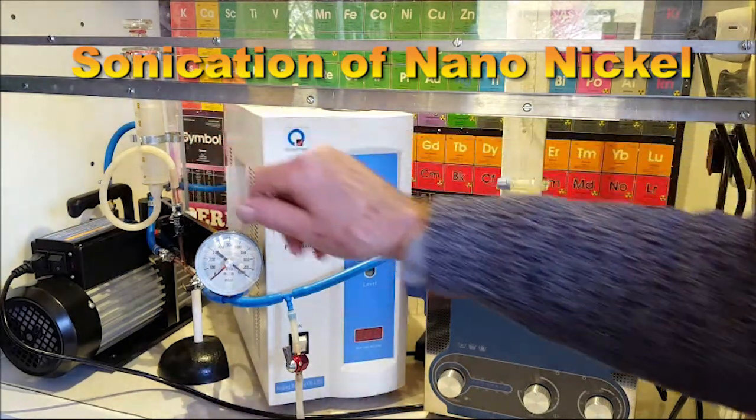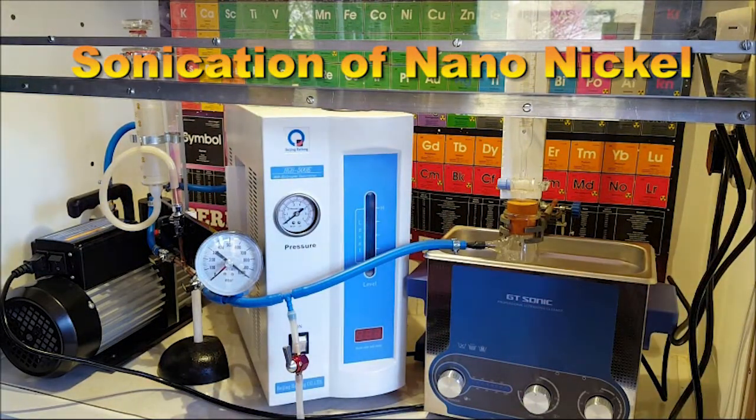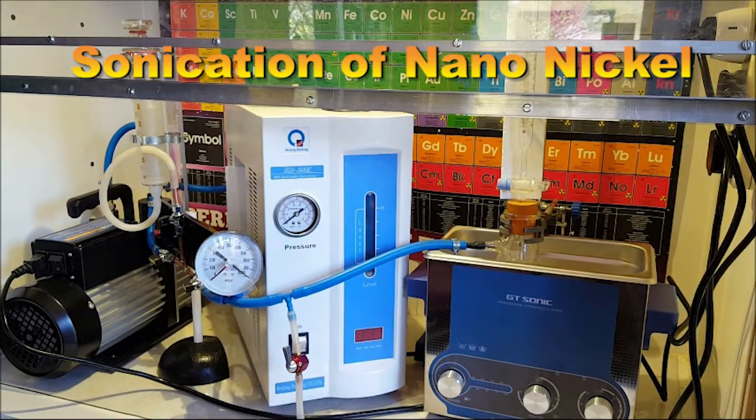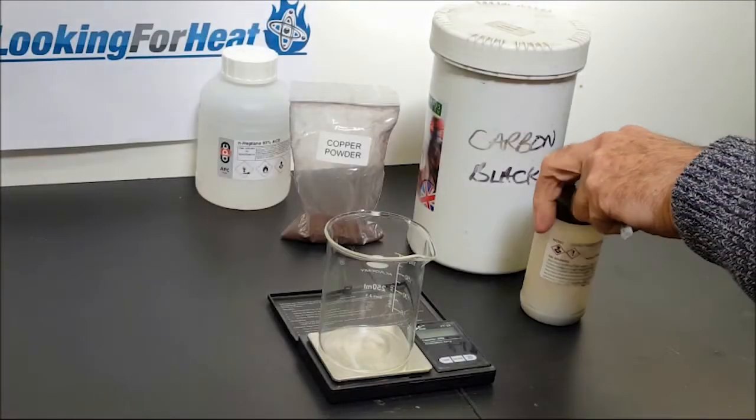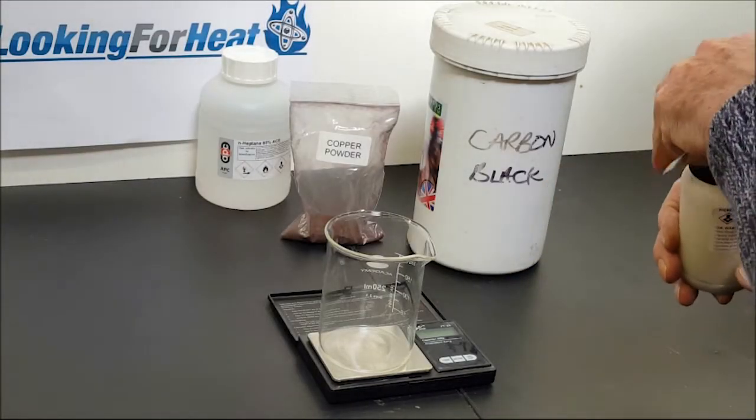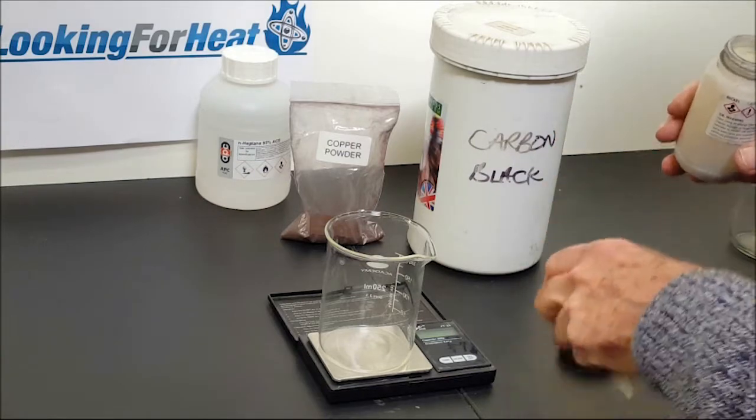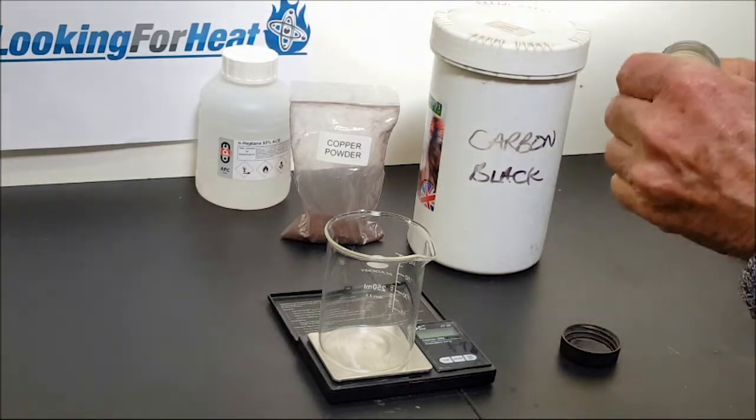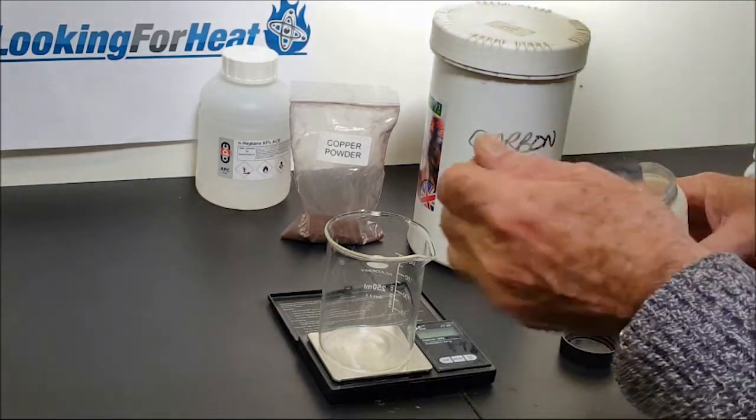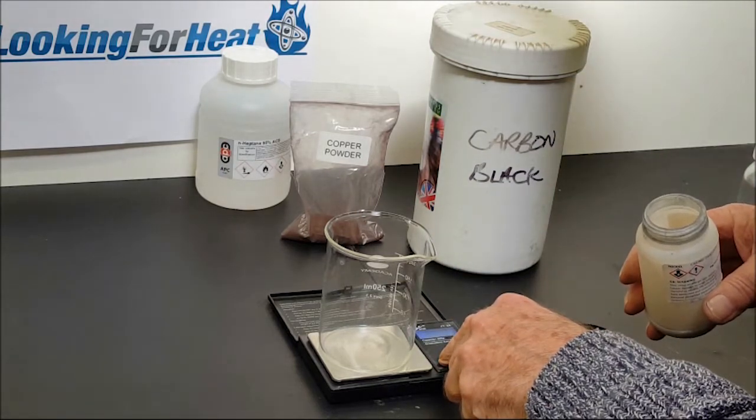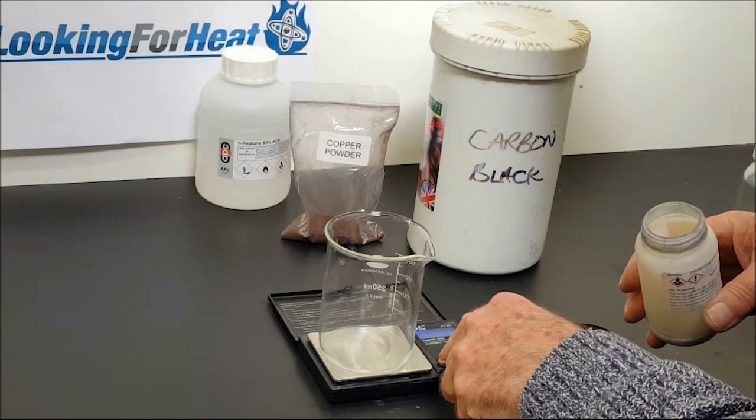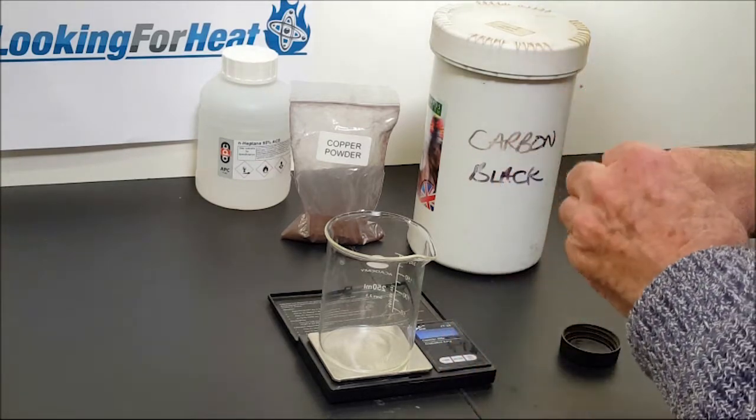Over here we have a gas syringe which probably won't be used this time, but it's in the system. I might as well leave it there. Now I'm going to weigh out the ingredients for sonicating an experimental fuel mix and set the scale.